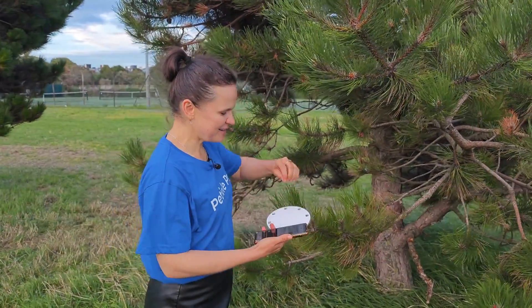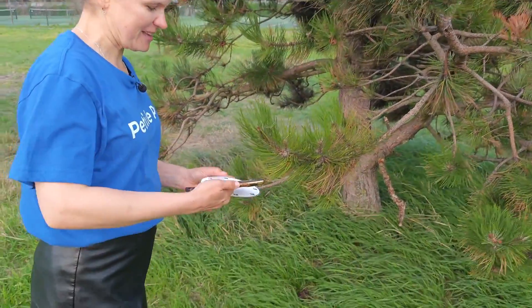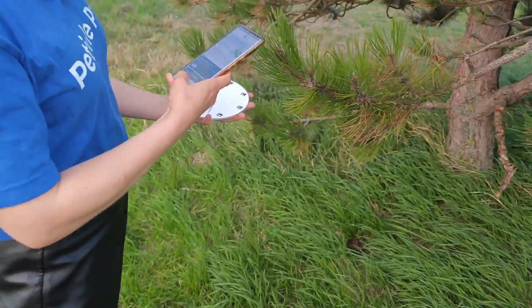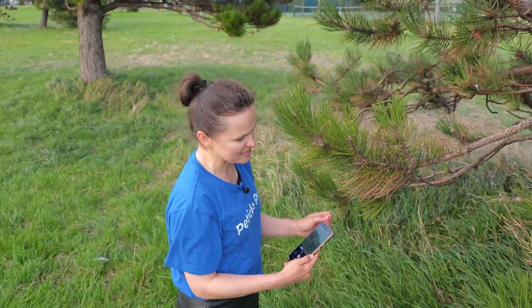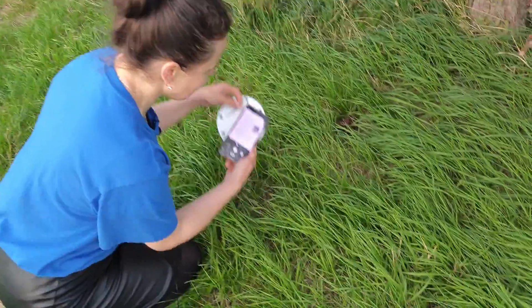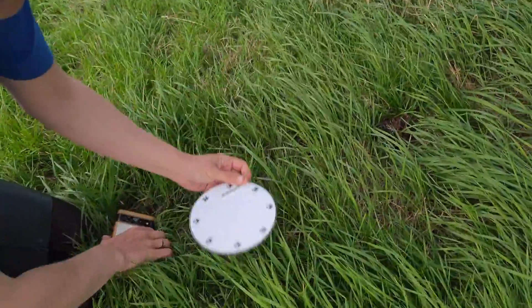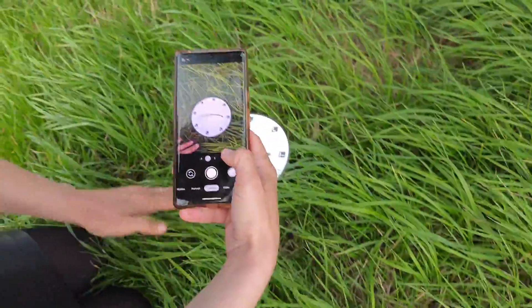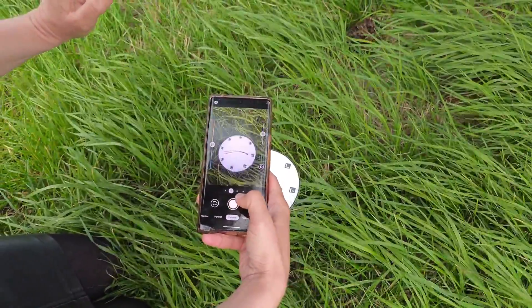What you need to do first is place your leaf on the calibration pad and make a photo of this leaf. It's very important to make sure the lens is clean and that all the markers around the calibration pad are visible and in focus of your camera before you take the photo.